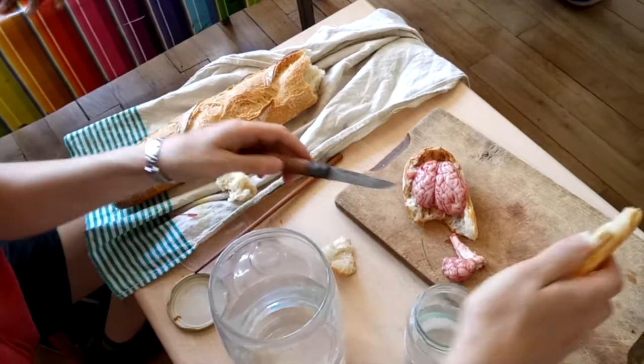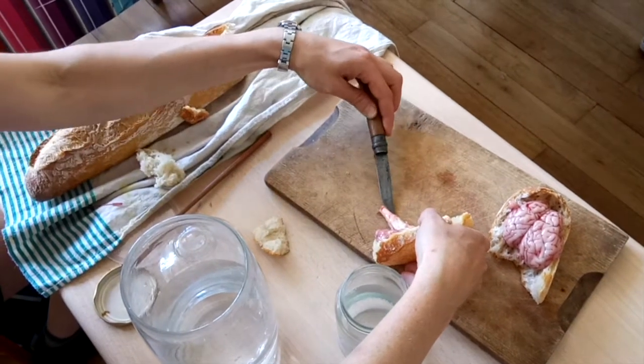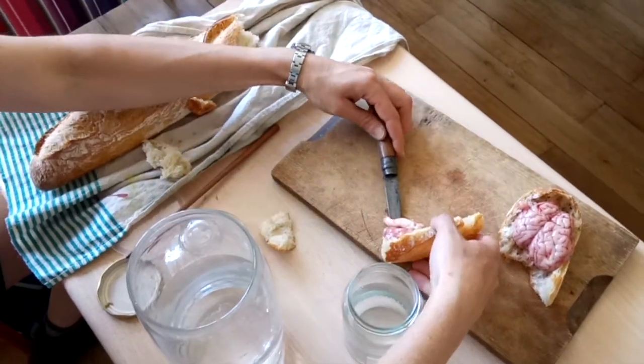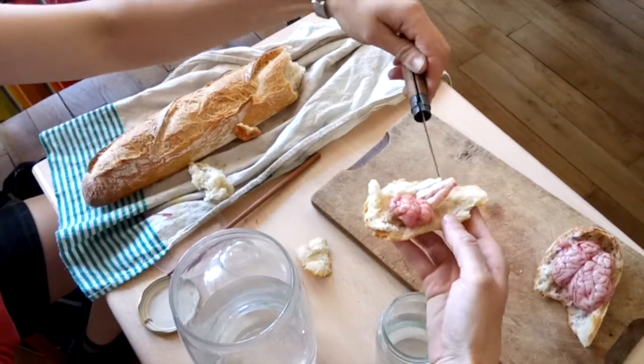These gestures are dangerous, you make attention. We don't have the right in fact. There's only me. Now we take the cerebellum. So the cerebellum — which serves? To balance.